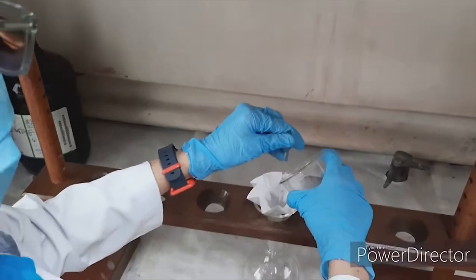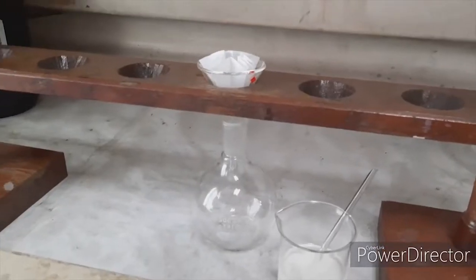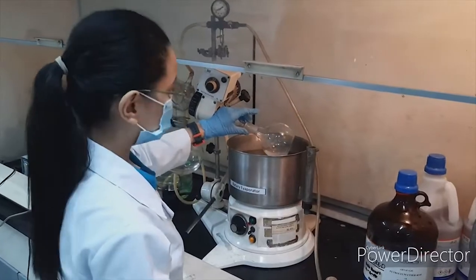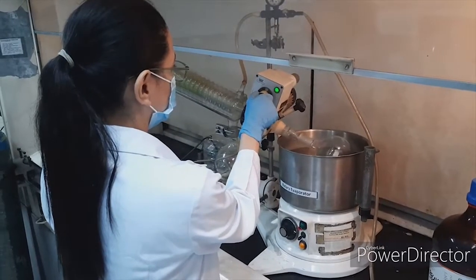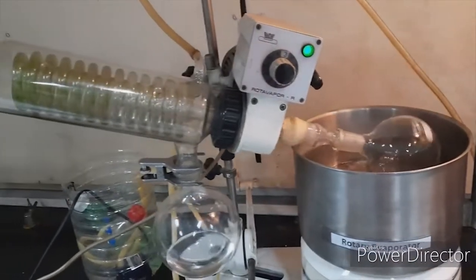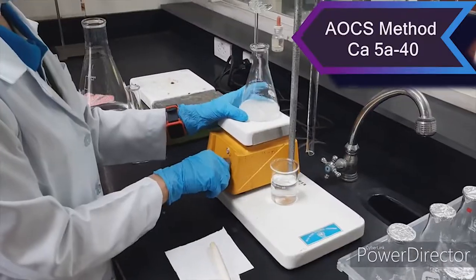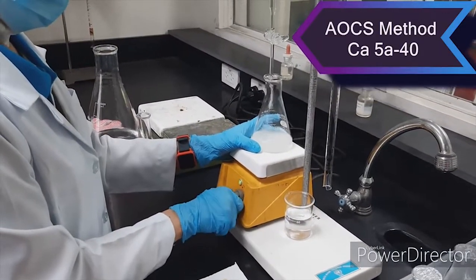For FFA analysis, solvent extraction is performed prior using petroleum ether to extract the oil from the solid sample. FFA is then determined using acid-base titration.